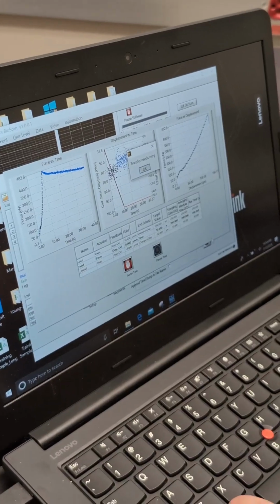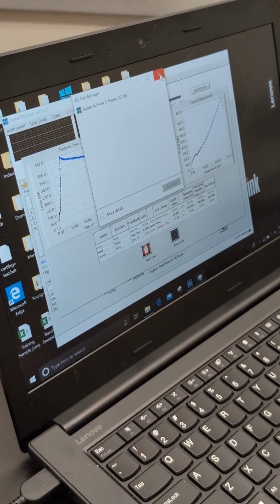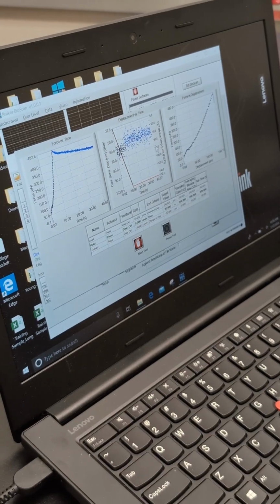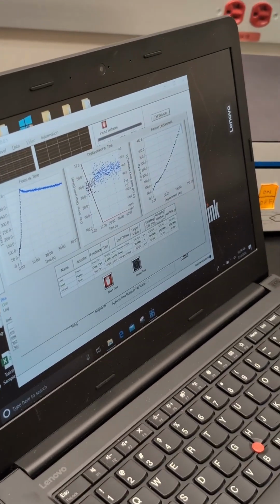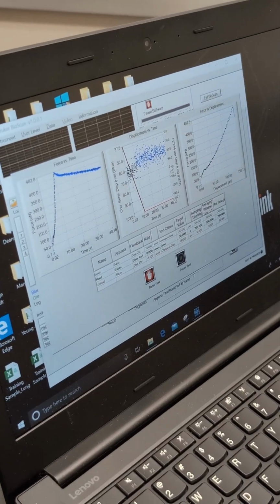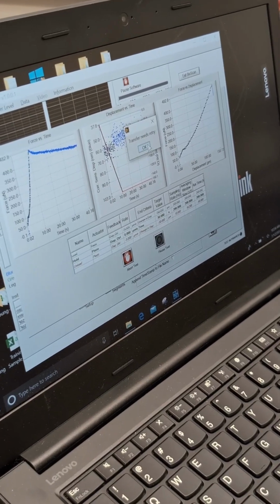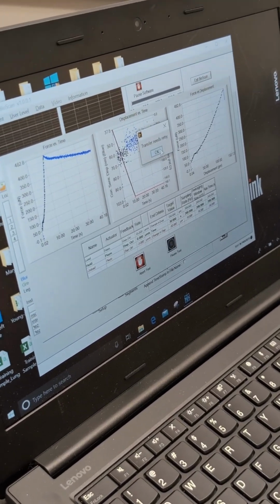basically it's already stopped recording, so you can raise it up a little bit, and then you actually need to do a hard reset. What happens is that it's stuck in a loop. It can't save the data. It will try to save the data, but it can't do it. It would show up this transfer needs to retry again.